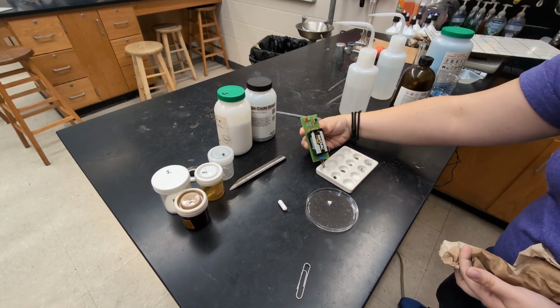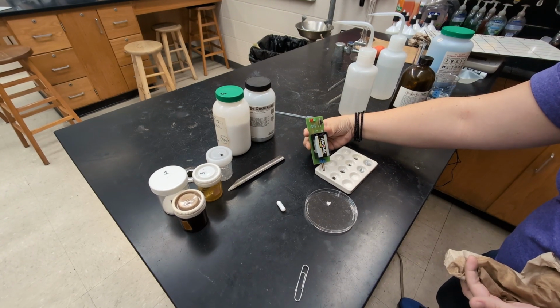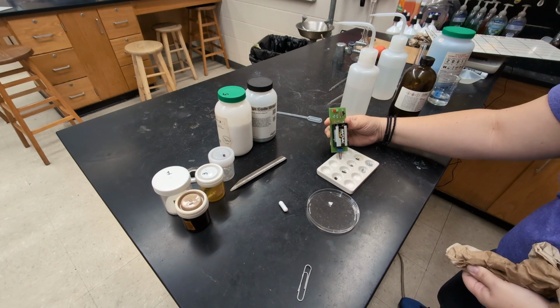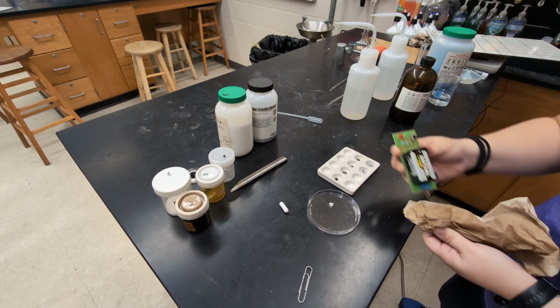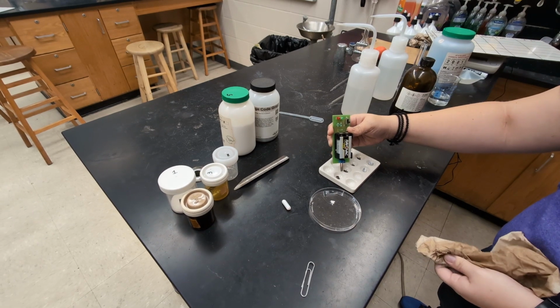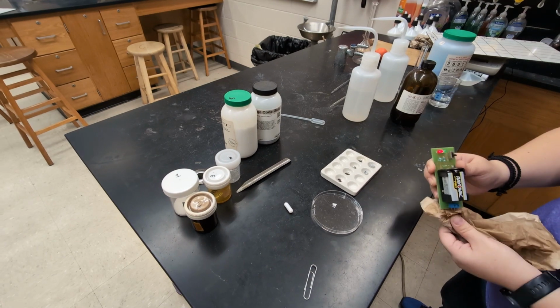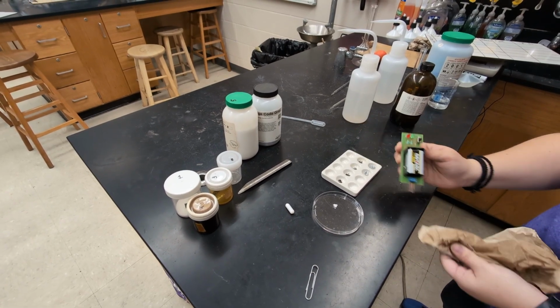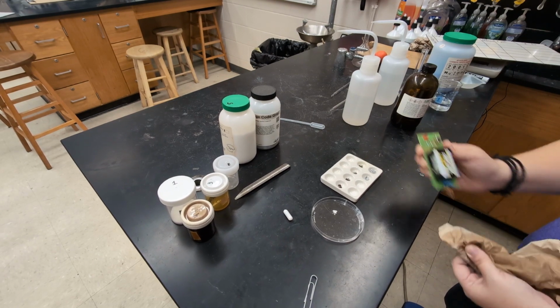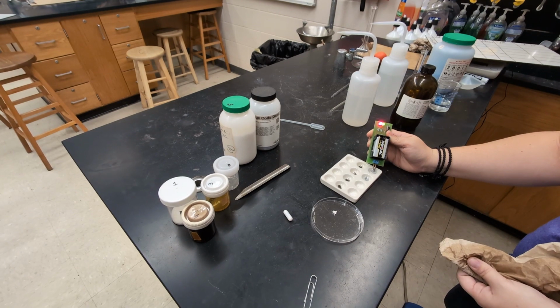So I'm going to go through, I just need to do one of the substances. I don't need to stick it in every single well. We're not seeing anything. Wipe it off in between. Not seeing anything. Oh, I did that one twice. And our last one. So you see, only this last one conducts as a solid.